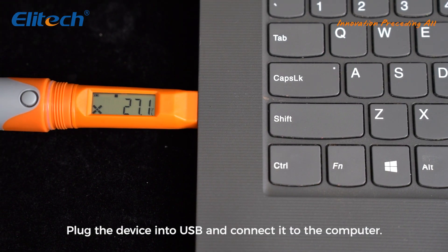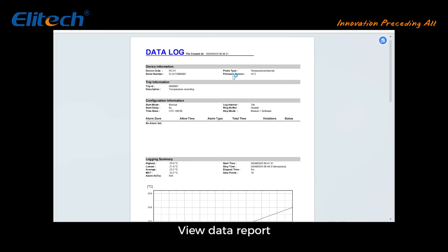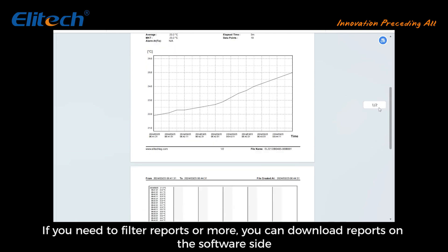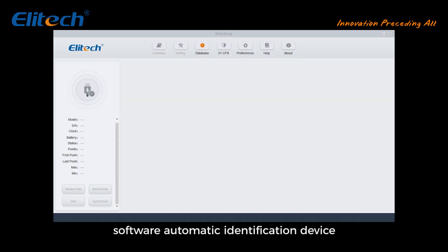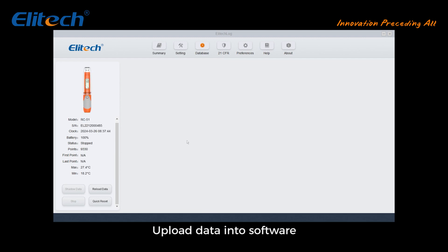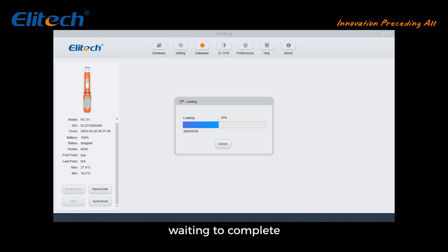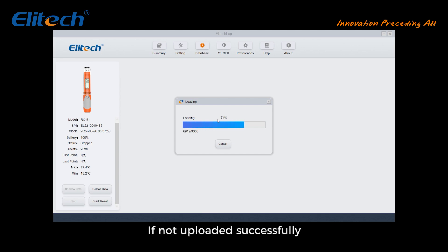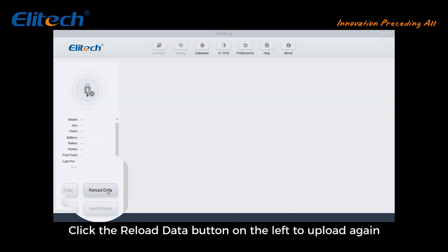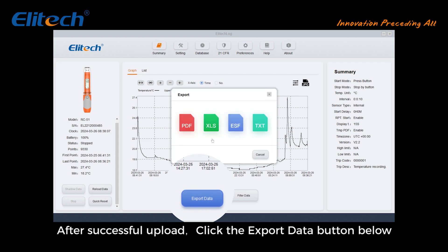Plug the device into USB and connect it to the computer. Identify the drive letter of the device to view the data report. If you need to filter reports or more, you can download reports on the software side — the software will automatically identify the device and upload data. Do not do anything during the upload. If the upload is not successful, click the Reload Data button on the left to upload again.